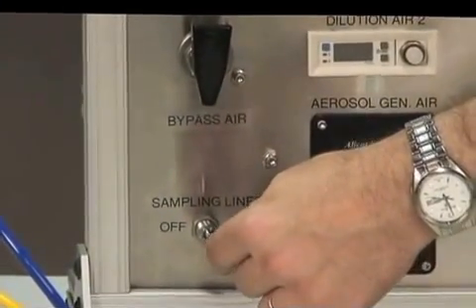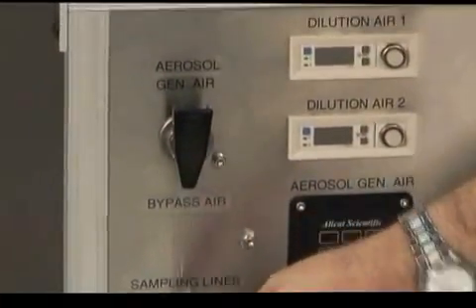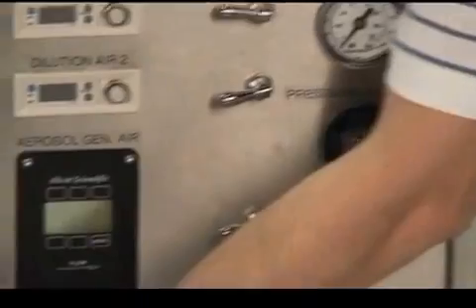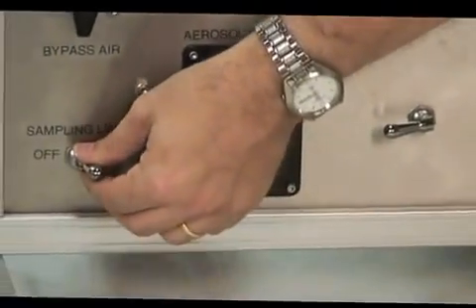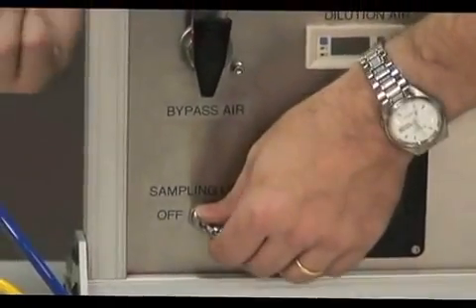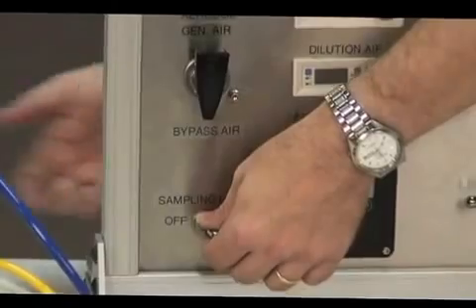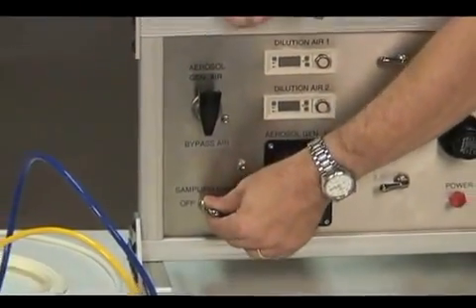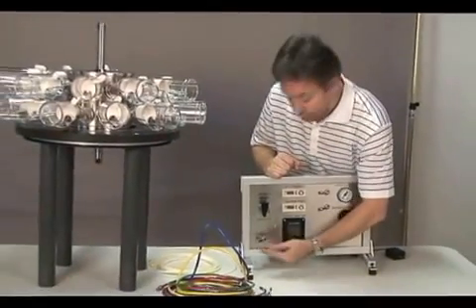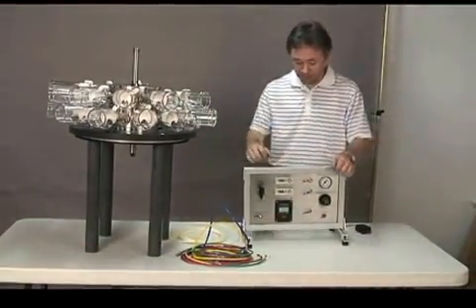The switch is connected to the vacuum pump, which is running all the time when the system is running. With the switch down, it is off, and when you lift it, it turns on, so both sampling lines are operating. Whether you use both at the same time or just one, you plug the other one if you use just one. But actually the system supplies vacuum to both sampling lines through this switch. You turn the toggle switch down, you turn off the sampling.